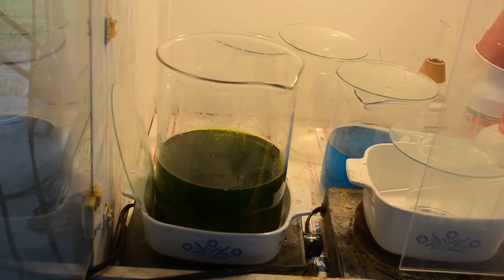So yeah, see, that's one way I can always tell whether the gold's fully dissolved or not, if there's nitric acid left over in the solution. But if there's no nitric left, then I got to worry there might be some gold left in there. So let me decant this stuff off.